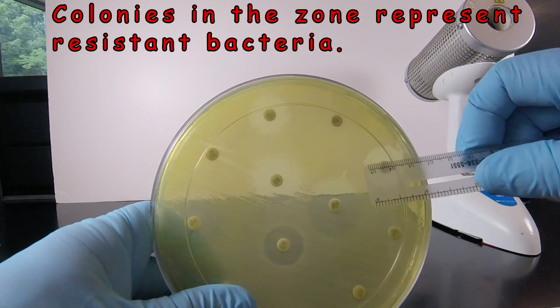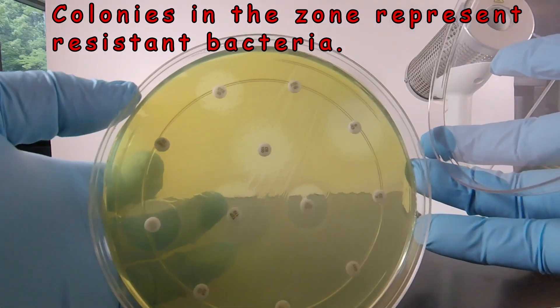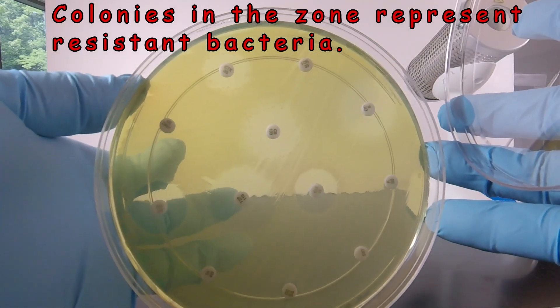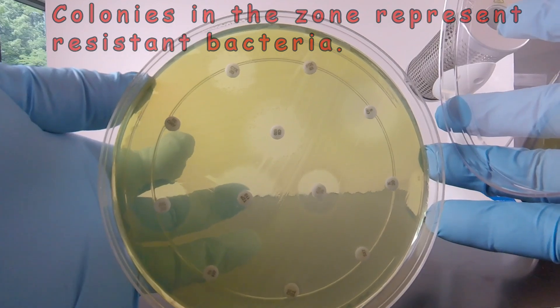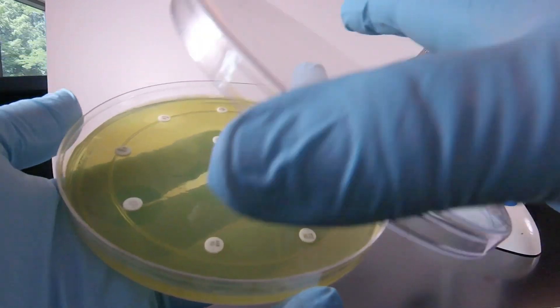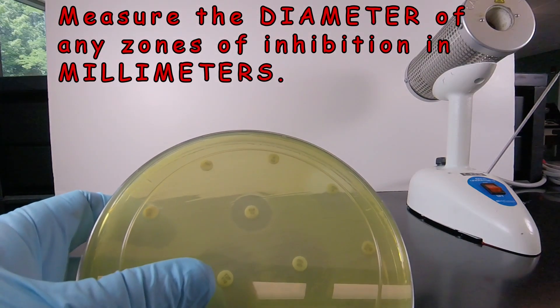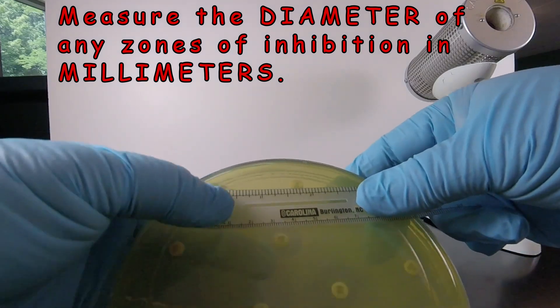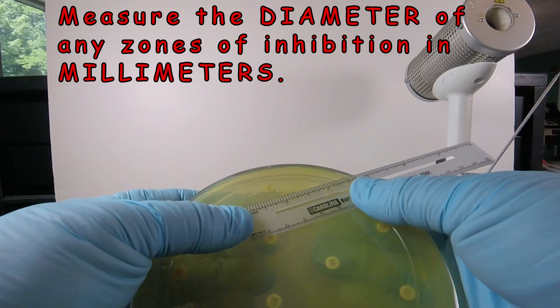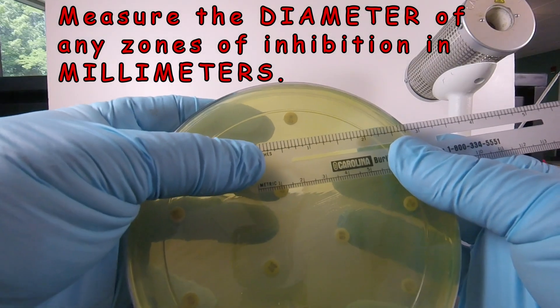When we measure, we hold the ruler up against the bottom of the plate. I'll turn this over so you can see the colonies a little better and take the lid off. You can see around this antibiotic and this antibiotic there are distinct colonies in the zone. Let's start with one that has a nice clear zone of inhibition — this gentamicin disc right here. We set the ruler so it goes right through the center of the disc from one edge to the other, and this one measures 19 millimeters across.